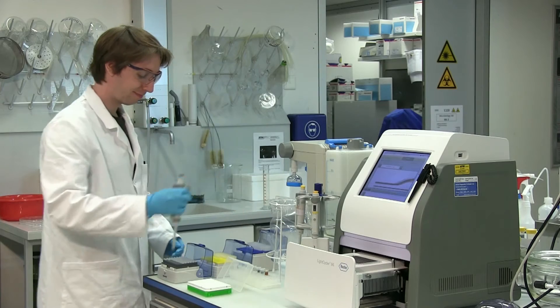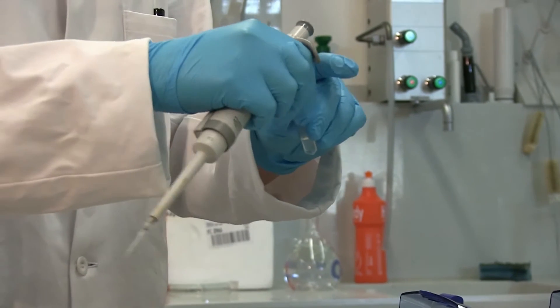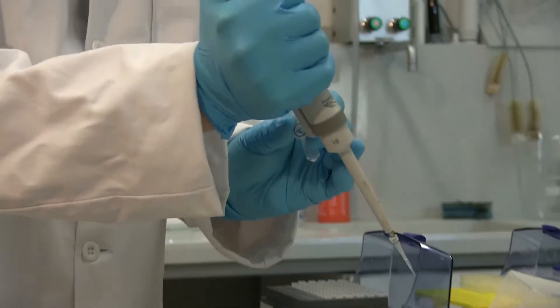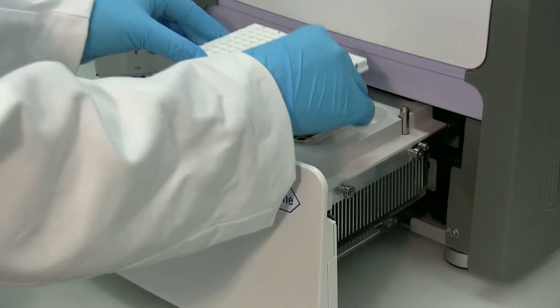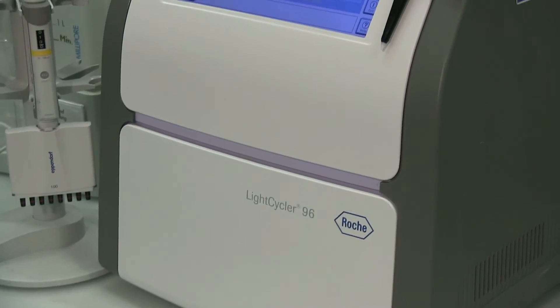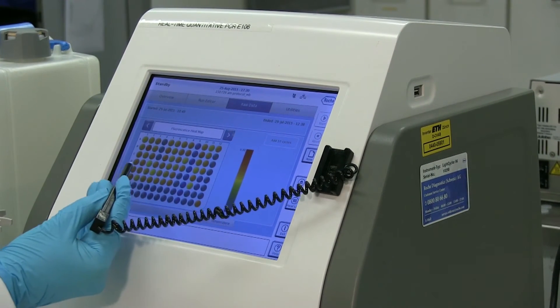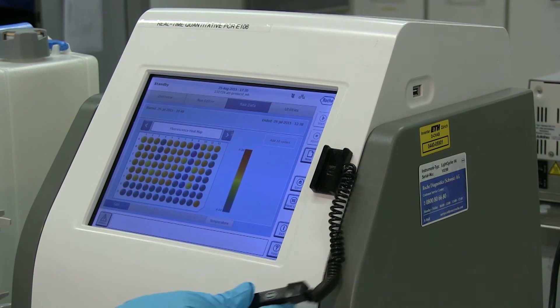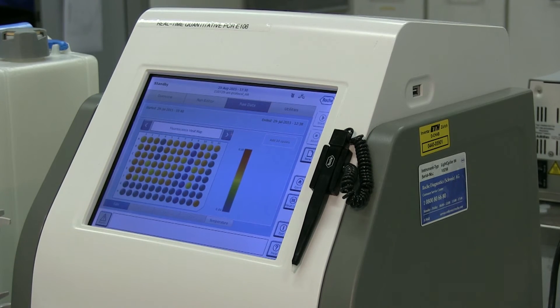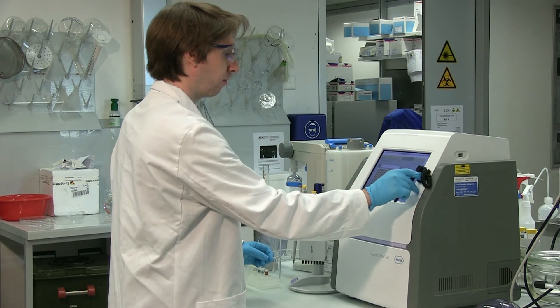Here we show how this is done with nanoparticles instead of balls. A solution containing only a few numbers of particles is divided into very small beakers corresponding to wells. This machine can measure if a well contains DNA or not, which is indicated with the blue spots for no DNA, and the orange ones for the presence of DNA. In our case, this corresponds to whether a well contains a particle or not. This allows an indirect counting of individual nanoparticles as easily as counting sheep.